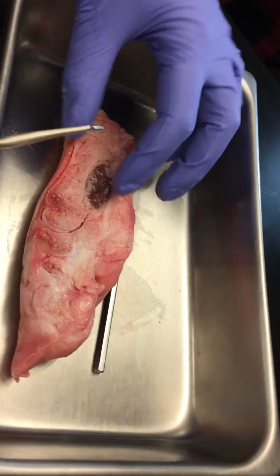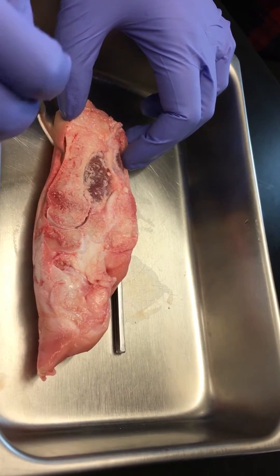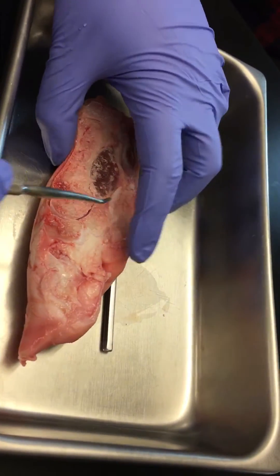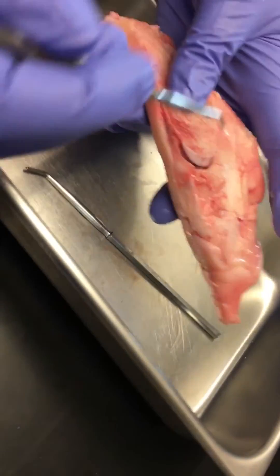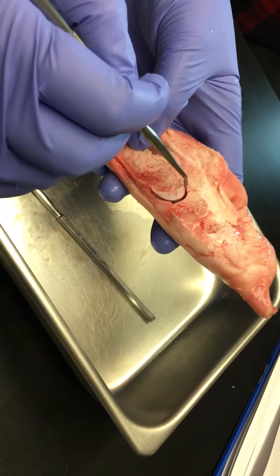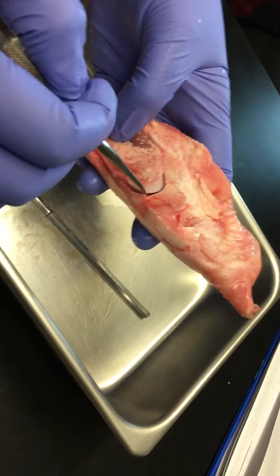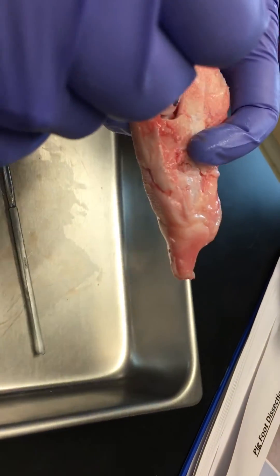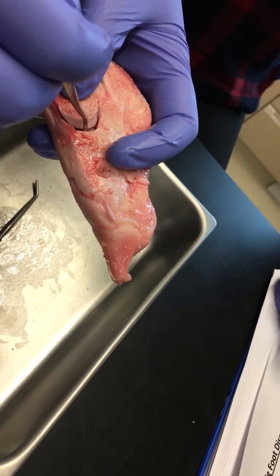That's a good example. The periosteum is the skin that surrounds all of this bone on the outside — it's very, very thin. Up here is where all the joint structures are. On the tip of this bone, capping it, there's our articular cartilage — very smooth hyaline cartilage for frictionless movement. You'll find hyaline cartilage on this bone as well, right here capping it, because these are the two bones that are articulating.